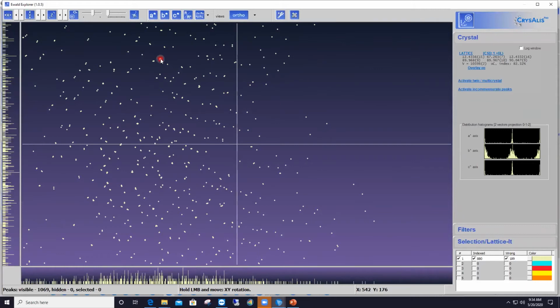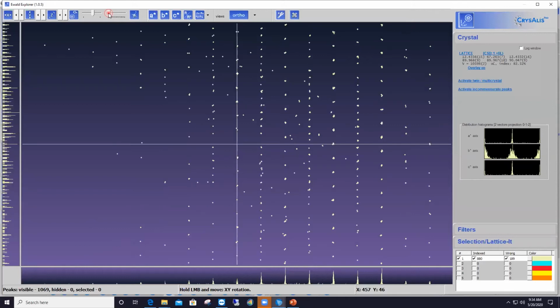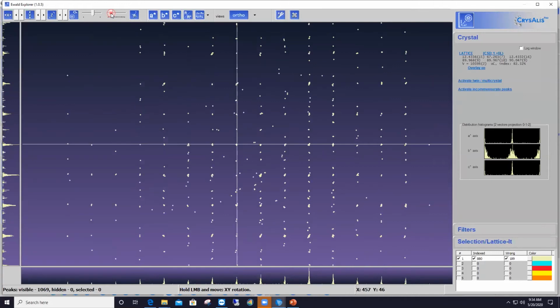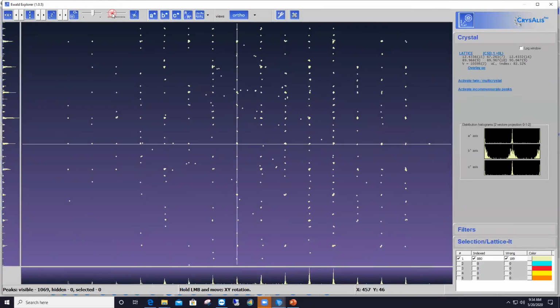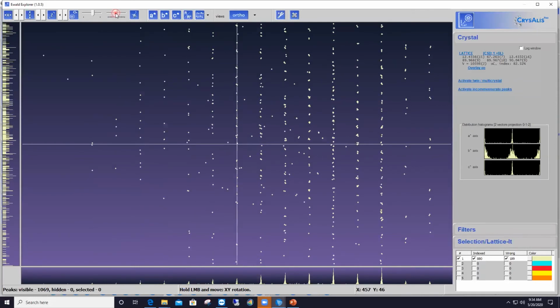I want to point you also to another option at the top of the interface, the one that says find views. Beside it, you have a scroll bar with a lot of little ticks, and each one of these ticks represents a preferred orientation of the reciprocal space. So with the left mouse, if I click on this bar and slowly slide it to the left, one by one, you see I've got a different orientation of the reciprocal space. You're welcome to use that to see if one of those orientations might show you exactly what you want to see, meaning intertwined rows of reflections.